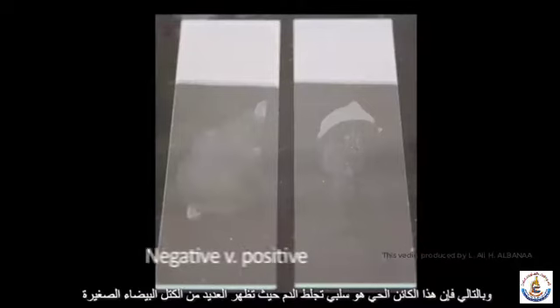No clumps are seen in the suspension on the left. Thus, this organism is coagulase negative. Many tiny white clumps are visible in the suspension on the right. Thus, this organism is coagulase positive.